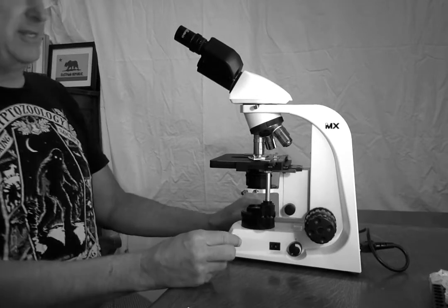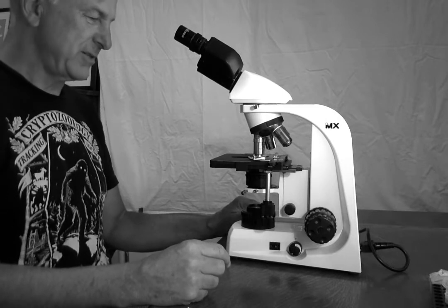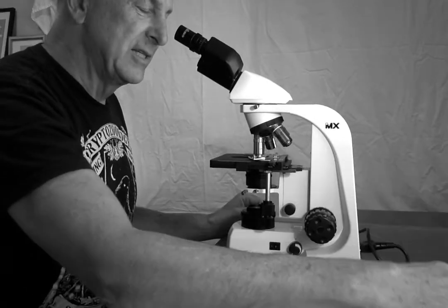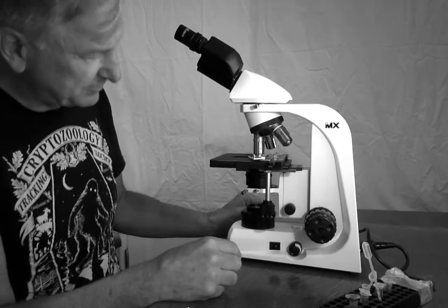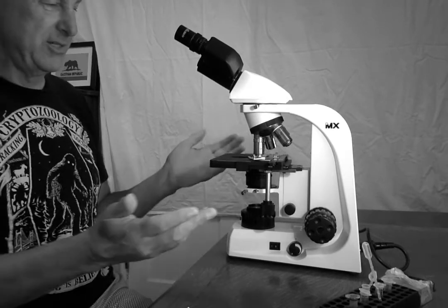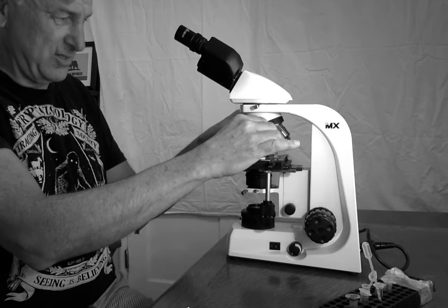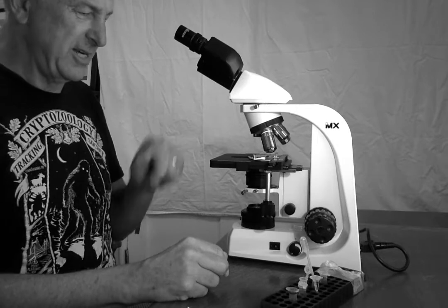All right, so finally, suppose we want to go to even higher magnification. Suppose we found something super cool, but we want to see it even better. Something very small. We may use oil. So this last objective is a 100x objective, and it is for use with oil. And what I'm going to do with that is I'm going to move my objectives so there's a big gap between the 40x and the 100x.